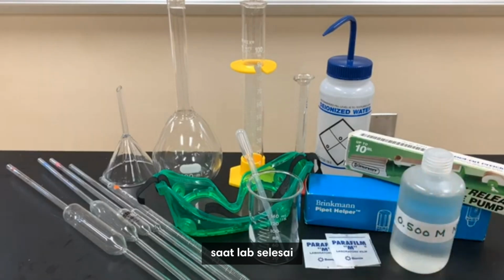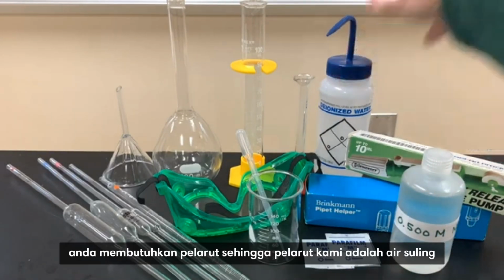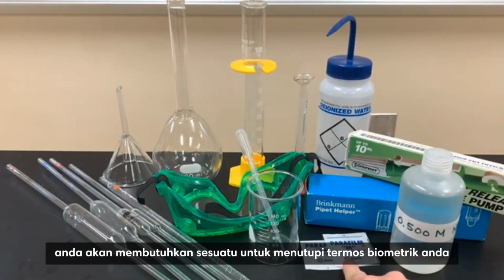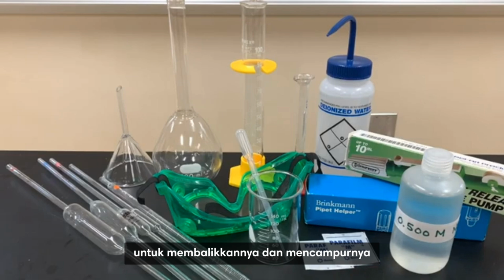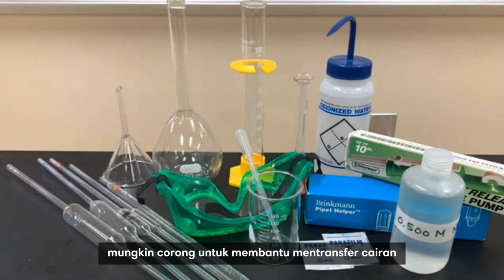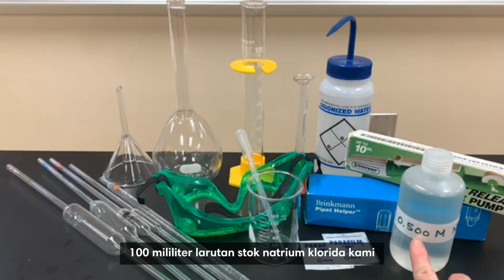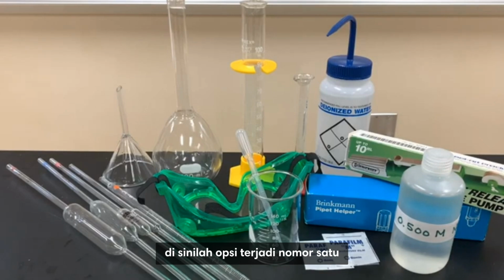Never measure out of the stock bottle or put anything back into the stock bottle when the lab is over. You need solvent. So our solvent is distilled water. We're going to have that. Next, you'll need something to cover your volumetric flask to invert it and mix it. Maybe a funnel to help transfer the liquid. Safety goggles, and the most important is how are you going to measure this 100 milliliters of our sodium chloride stock solution? This is where the options happen.